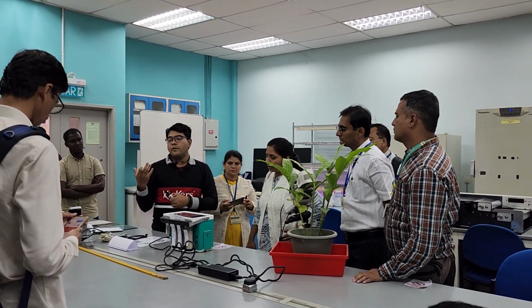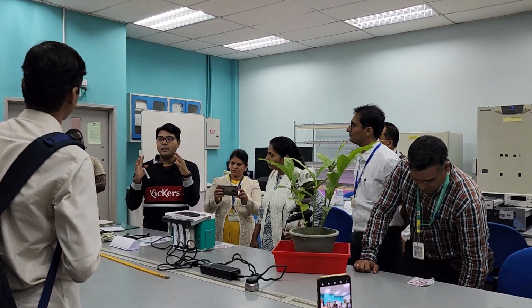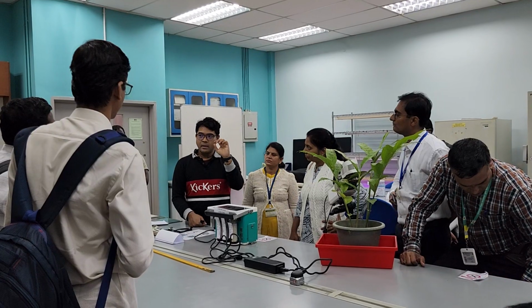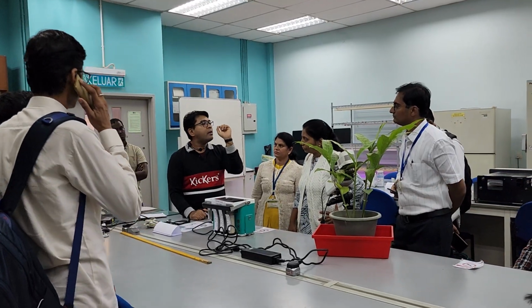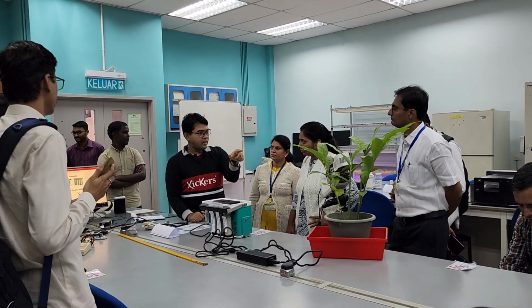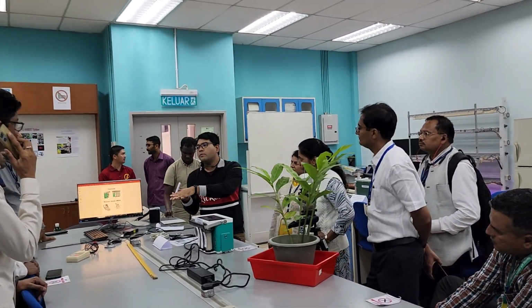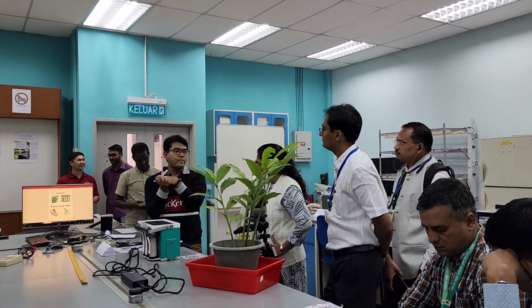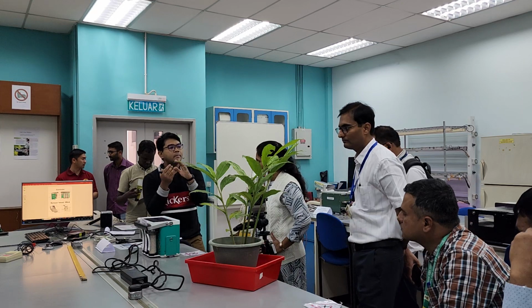If you're not familiar with fluorescence, it's our easy way to say glow in the dark. We measure how much the leaf is glowing in the dark, but the glow given off by this leaf is invisible to our eye. It's in the far red region; we can't see it, but this machine can. We measure this glow because it tells about the stress status of the plant, the chlorophyll a, the health of the plant, and so on. Hence the technique is called chlorophyll a fluorescence. What is the normal range for this reading?